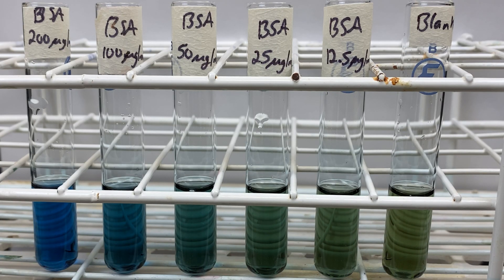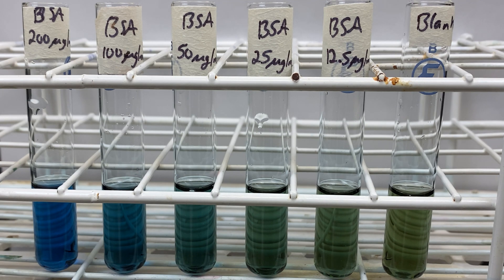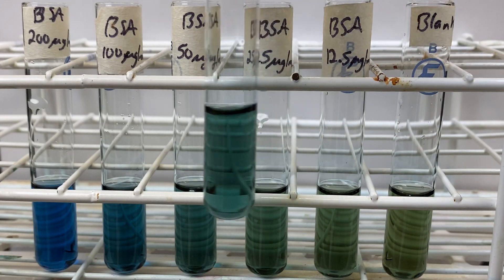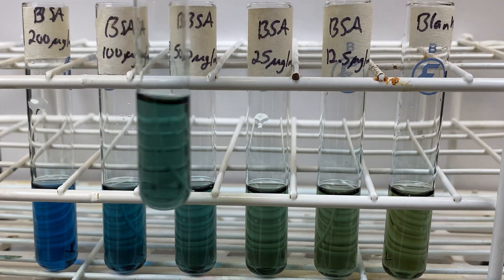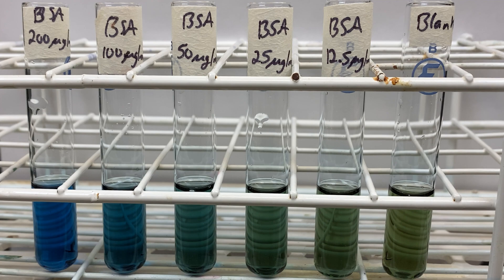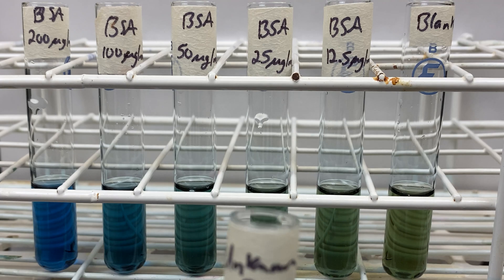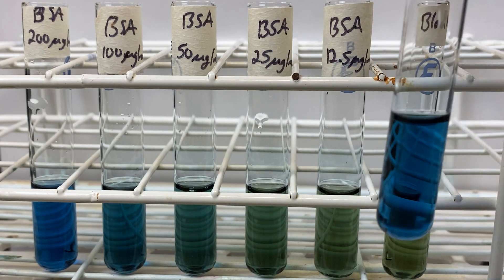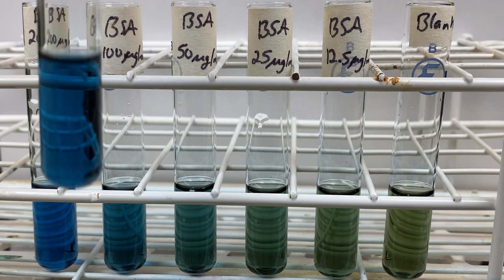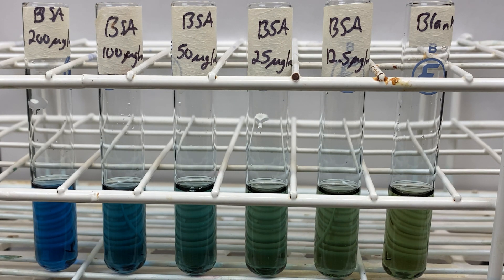For my standards, I used various concentrations from 200 all the way down to 12.5 micrograms per mil. I had two unknowns. This is unknown C. We can do a comparison to try and visually see where it is in terms of our standard. Looks like it's somewhere between 50 and 25. I have unknown D. You can see it appears to have a higher protein concentration. Visually inspect it — looks like somewhere between 200 and 100 micrograms per mil. But let's use a spectrophotometer to be sure.